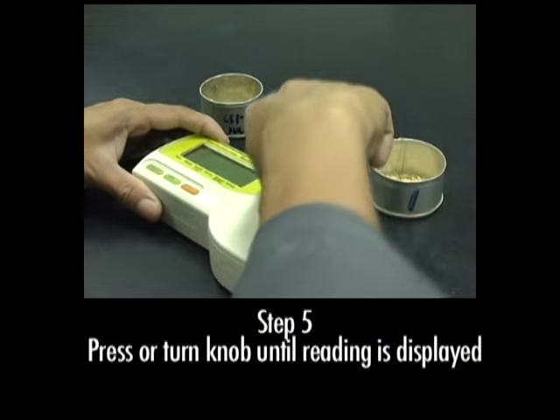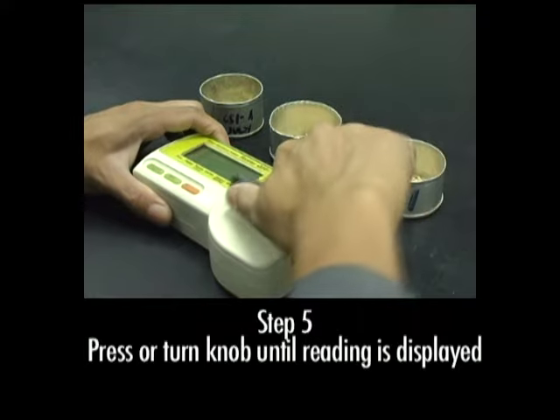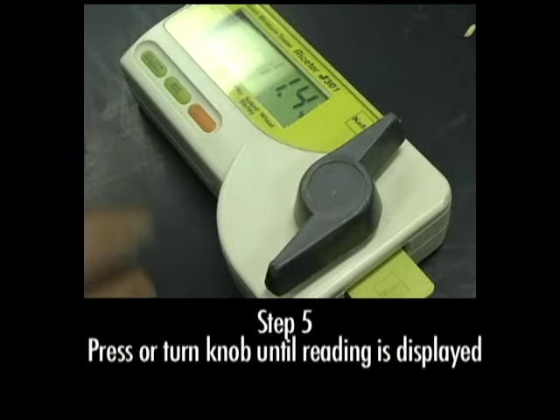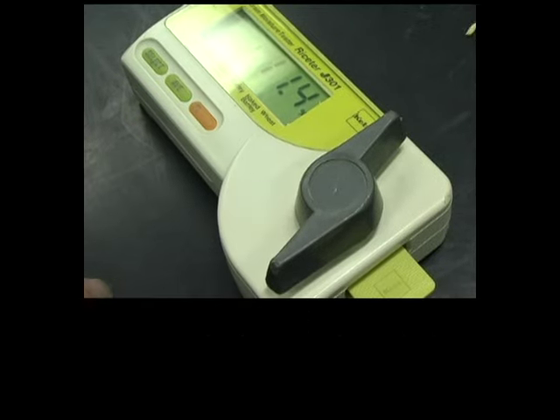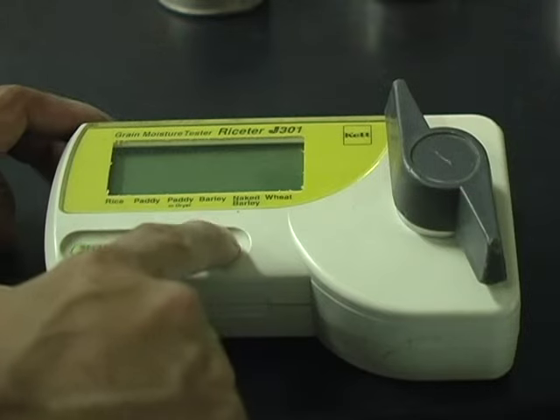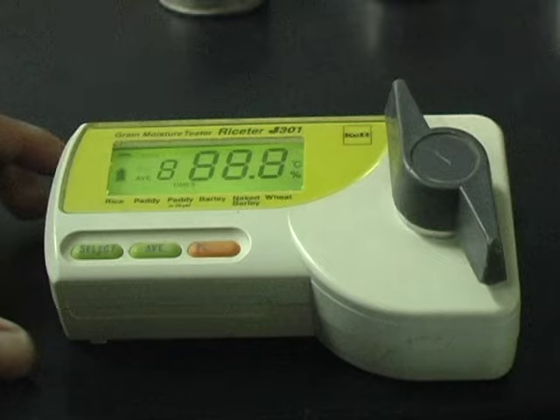It may take a little force, but make sure you turn the knob all the way as described in your manual, or you will get a wrong reading. Test at least 3 samples of the grain for an accurate moisture content reading.